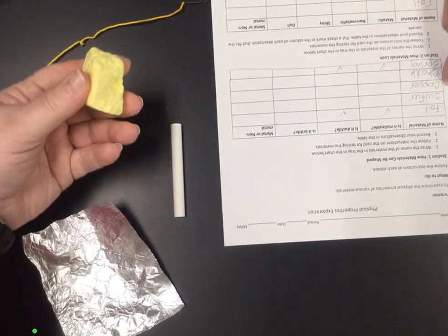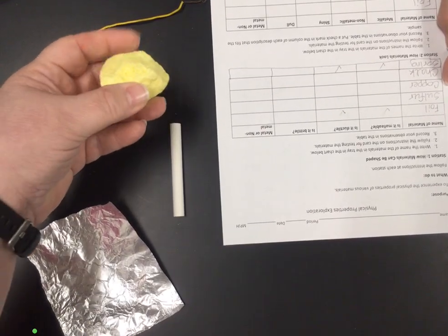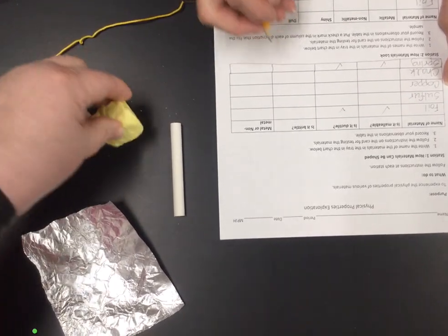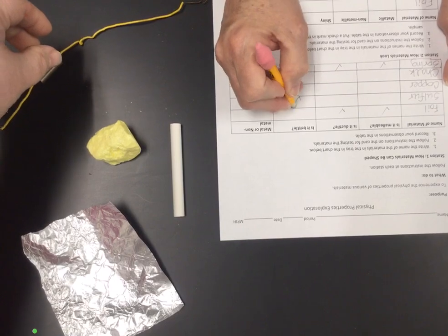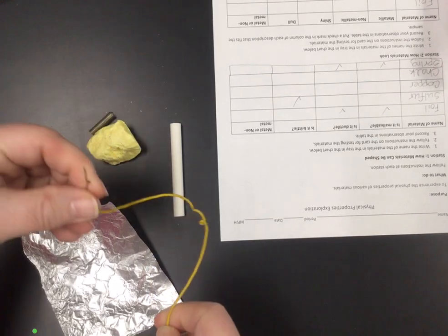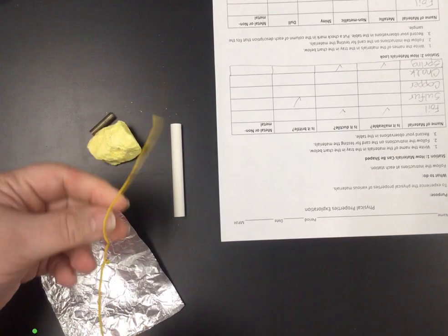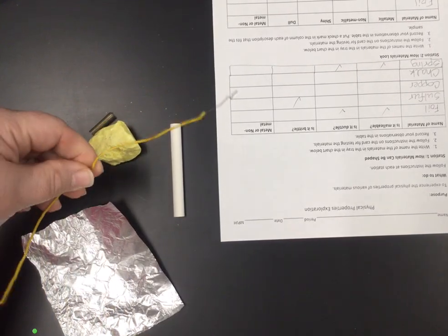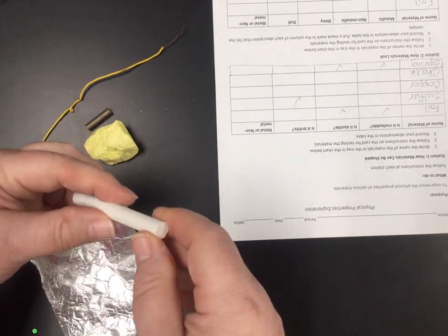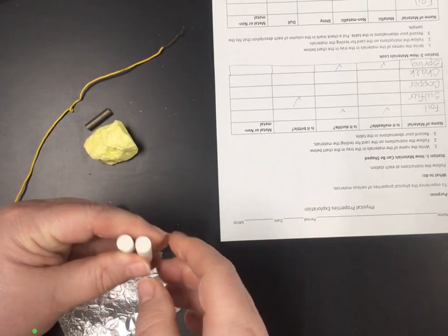The sulfur, this actually breaks. It's not malleable or ductile, either one. And so you're going to want to mark that one as brittle. The copper, I went ahead and put wire for this station because that's what ductile means, is that it's wire. And so having it ductile, check that one off there. And then the last one is chalk. And chalk breaks easily, so that one is going to be brittle as well.